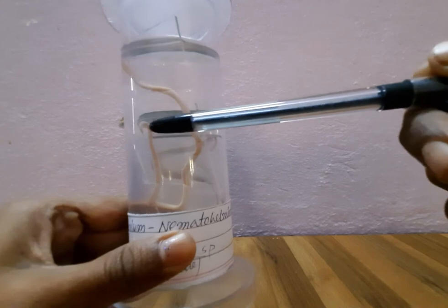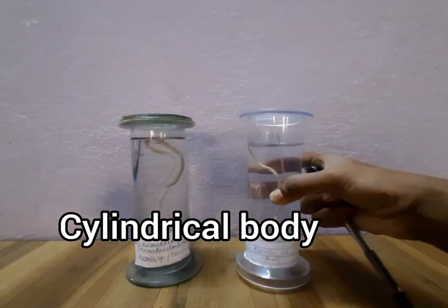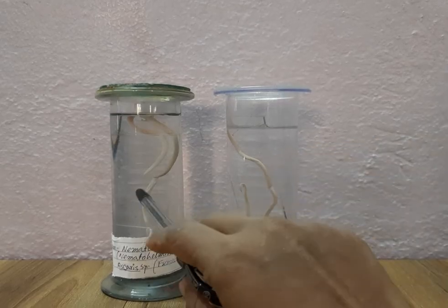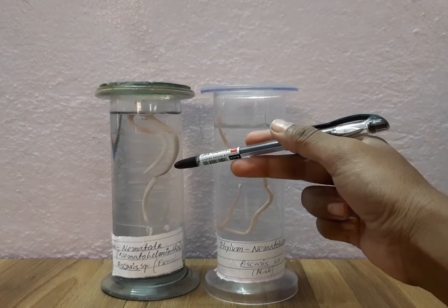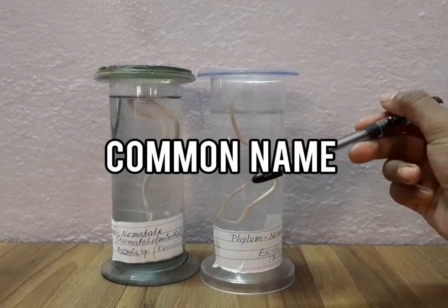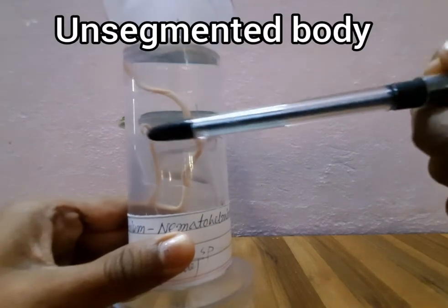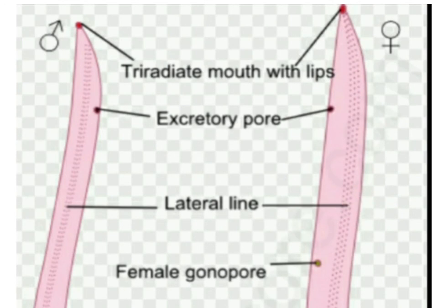What are the identifying characteristics of this organism? The body is cylindrical, tapering at both ends. There is presence of a tri-radiate mouth, presence of penial setae in males and a genital aperture in females. Ascaris lumbricoides is a common intestinal parasite of man, particularly found in small children, and also in pigs, cattle, monkeys etc. Infection occurs through contaminated food and water. This organism is commonly called Roundworm. It has a 20 to 40 cm long body, cylindrical, about 5 to 6 mm in diameter, and has no segments on its body surface.